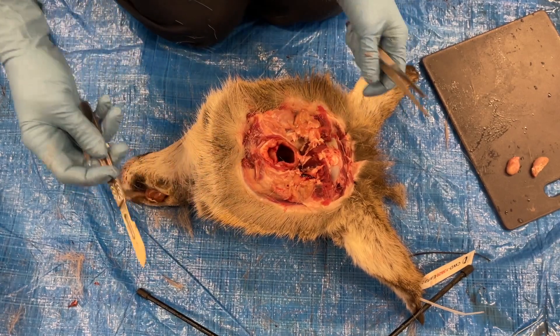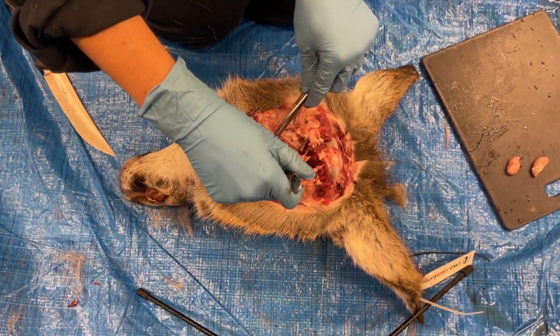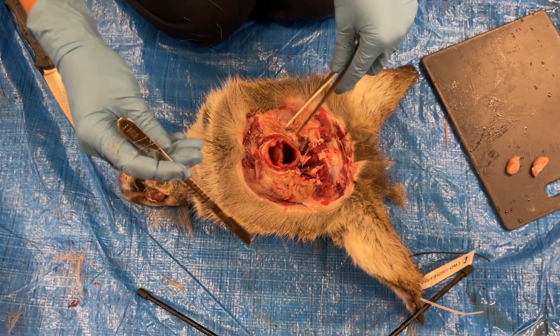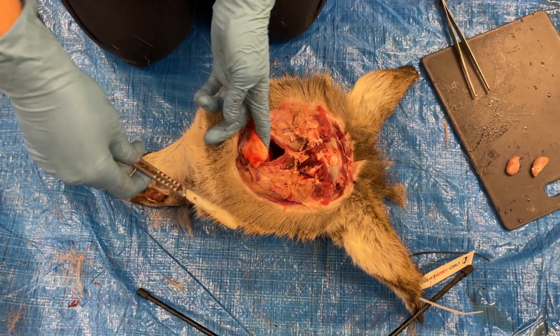The other tissues that need to be removed are called the tonsils. They are located in this area. The epiglottis, or the firm part of cartilage at the back of the throat, can be used as a landmark.